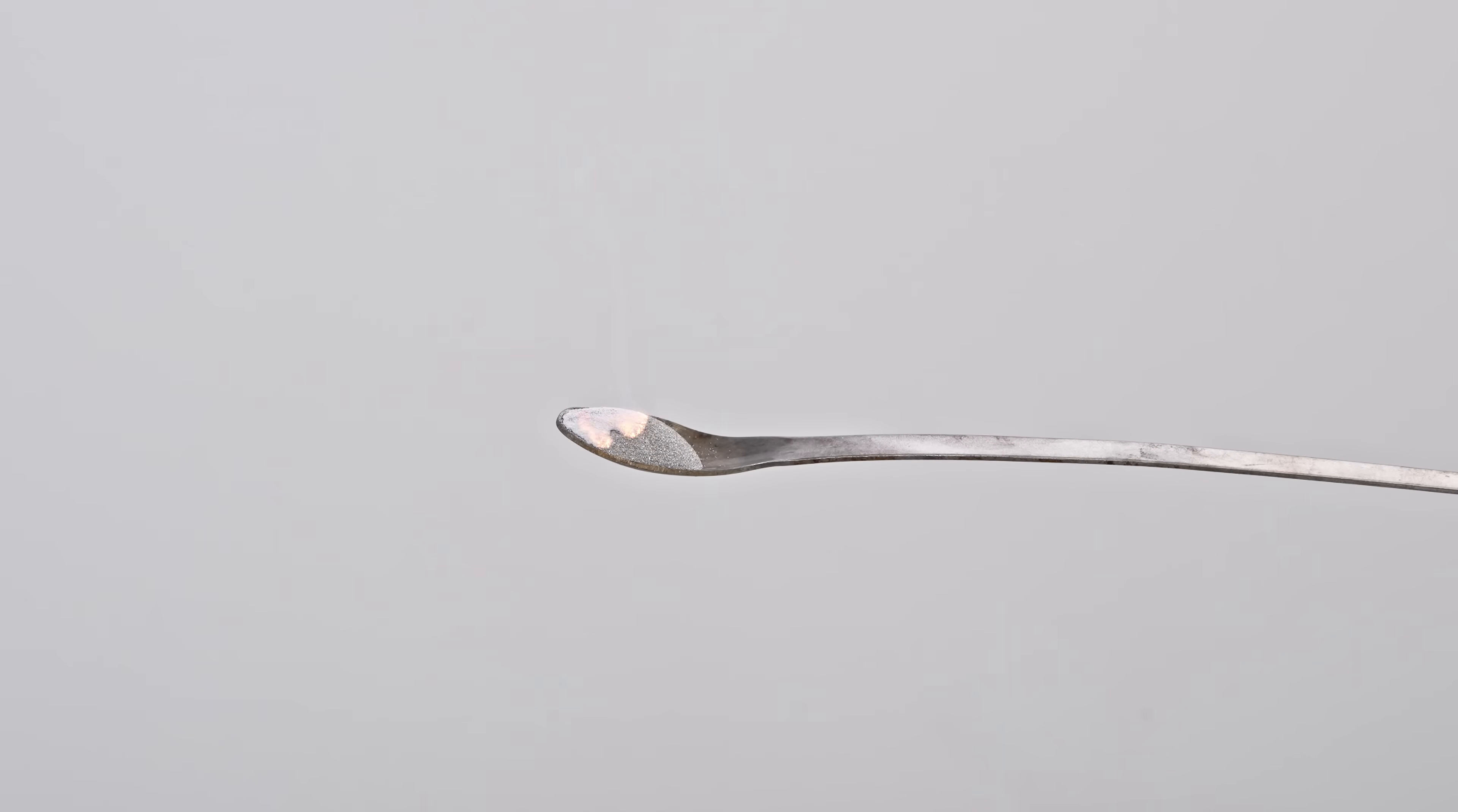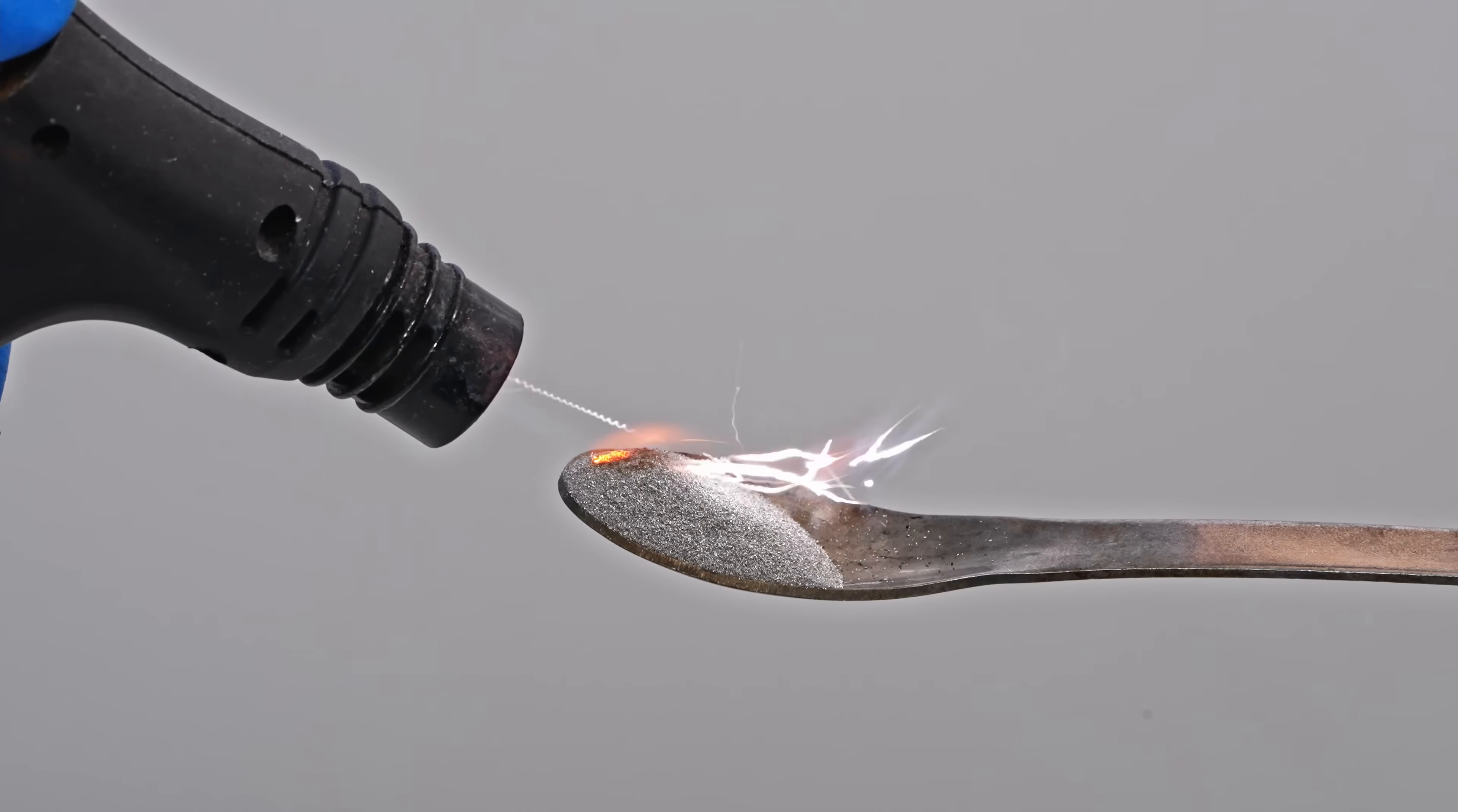Hey guys! Let's ignite some magnesium powder. Magnesium powder is highly flammable and ignites very easily.